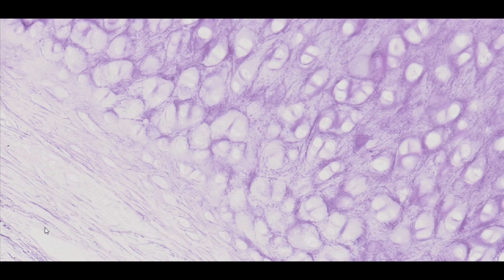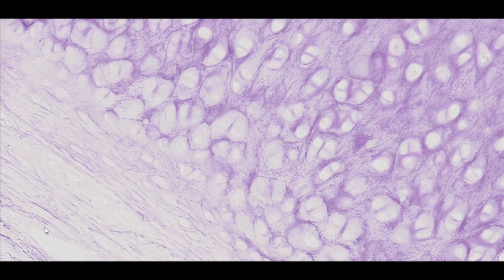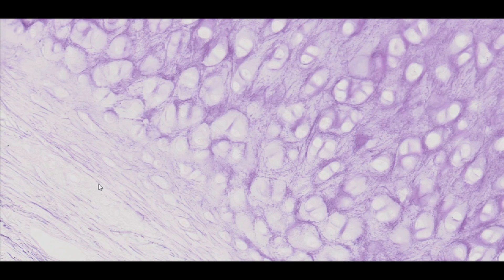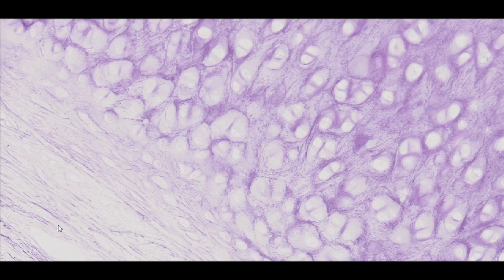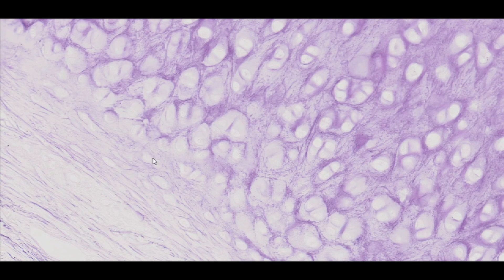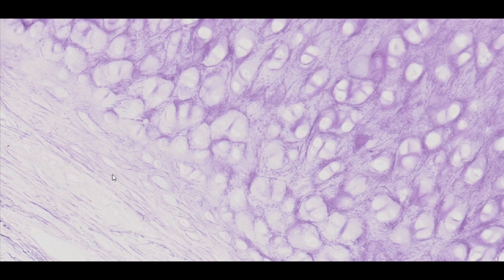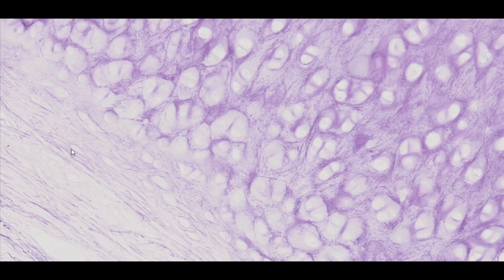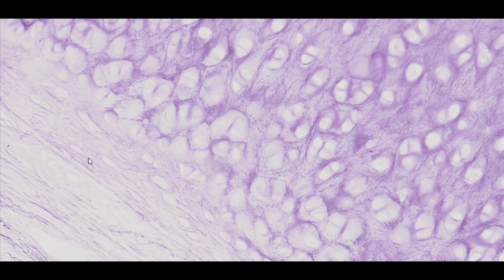Another common feature of elastic and hyaline cartilage is the presence of perichondrium. It is composed of two histologically different layers: a more external fibrous layer composed mainly of type 1 collagen fibres, and an internal loose layer with multiple flat chondrogenic cells. The perichondrium as a vascular layer is a source of nutrients for the cartilage that reach the cells by diffusion in the matrix ground substance.